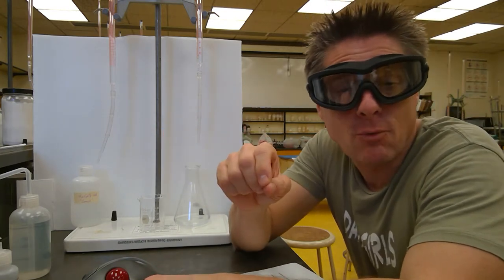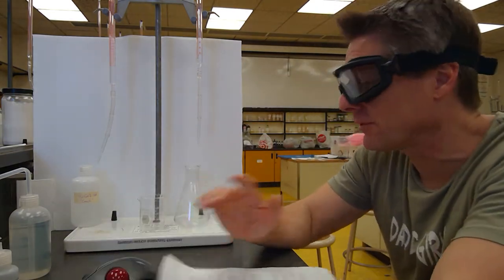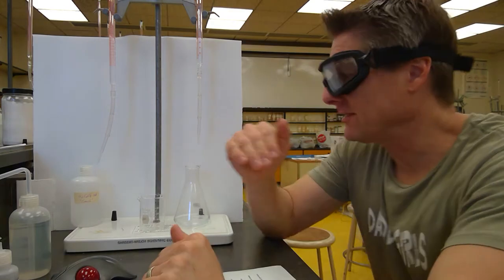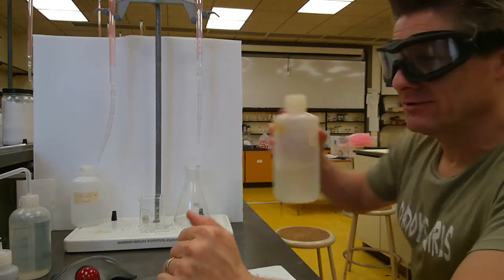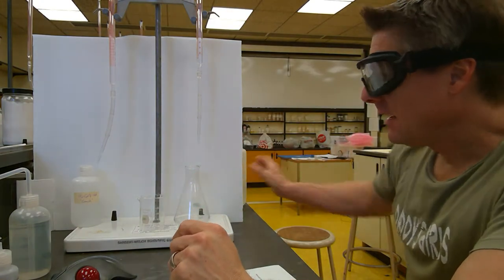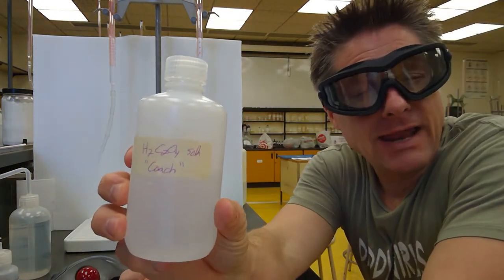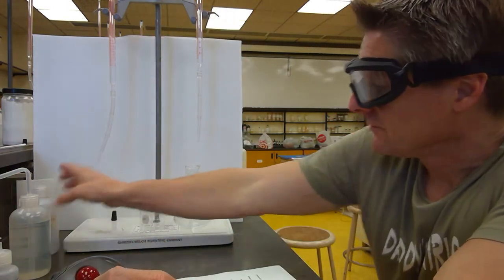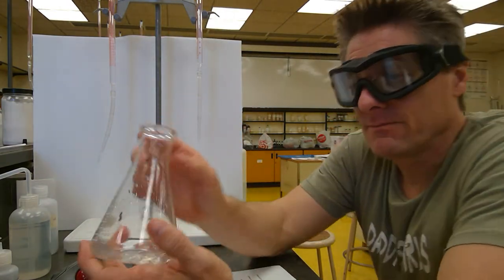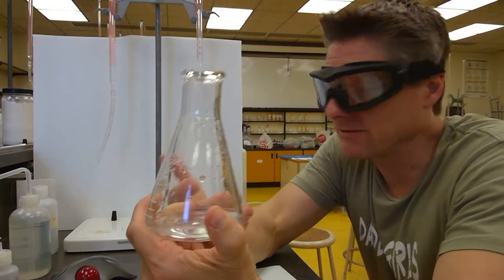Hopefully you know what an equivalence point and an endpoint are, right? That's important. So equivalence point is when your acid and base neutralize each other. So we'll always have a base, usually sodium hydroxide or something like that. And we'll typically have a back titrant, some kind of acid, could be any kind of acid. And then we'll have another acid in here. Maybe this is an unknown acid. We don't know its concentration.